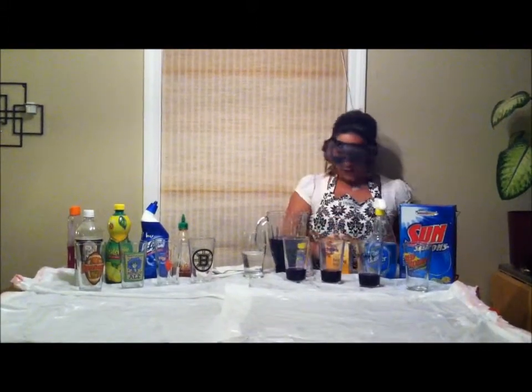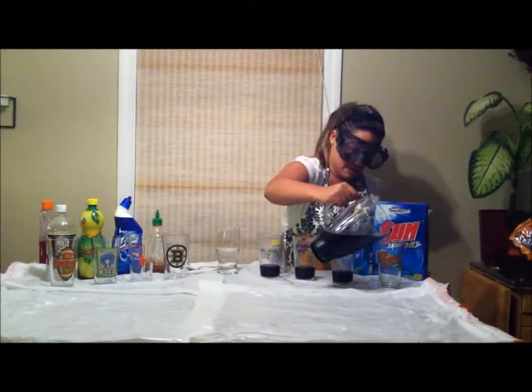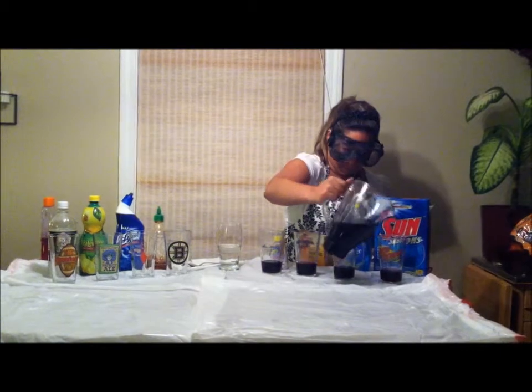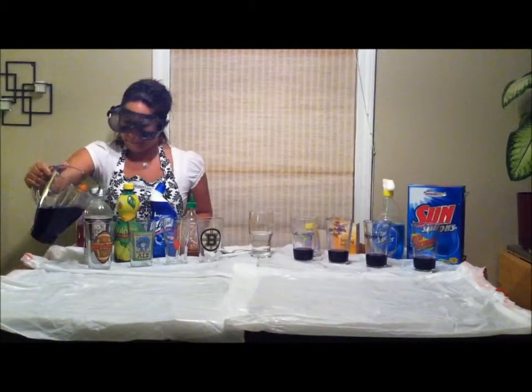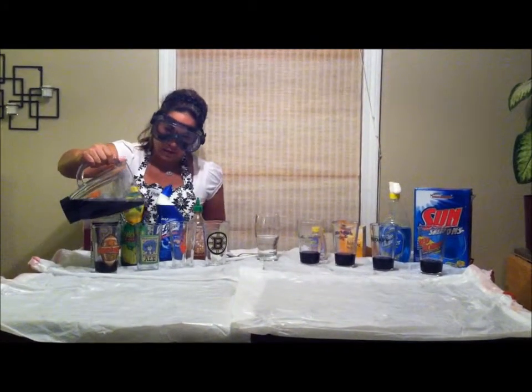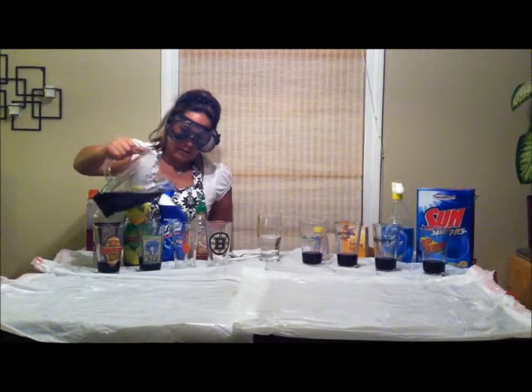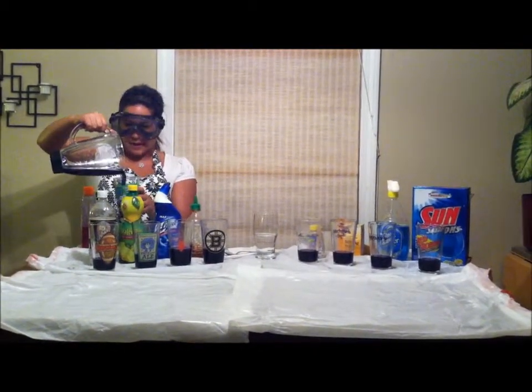So I'm going to add a little catalyst here, to speed the reaction up. We're going to fill up another glass for a mystery component that we have.